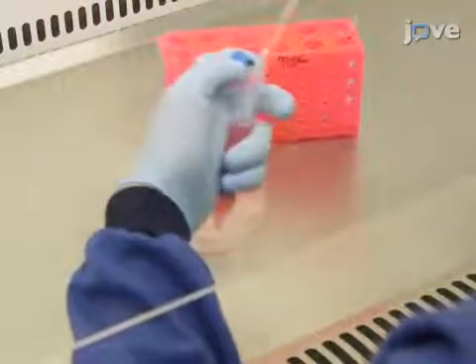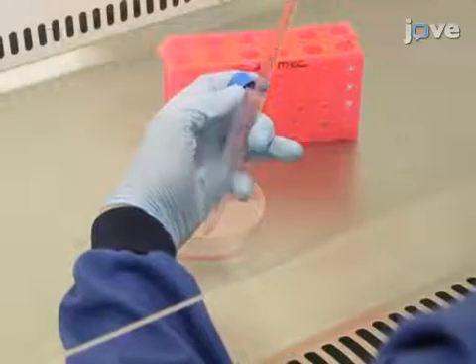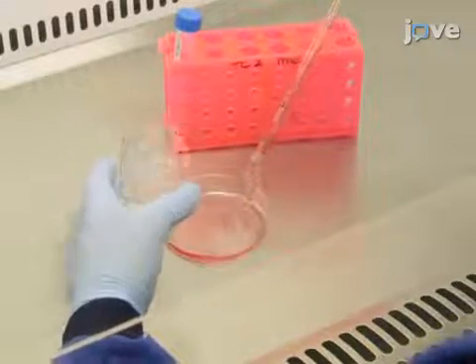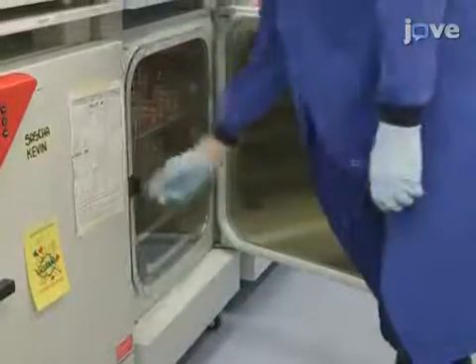Then, plate any standard mouse ES cell line on the coated dishes in standard mouse ES cell media containing 100 nanograms per milliliter of GST-tagged LIF, 10% fetal calf serum, and 5% knockout serum replacement. Culture the cells at 37 degrees Celsius, 5% CO2, and replace the media every day.